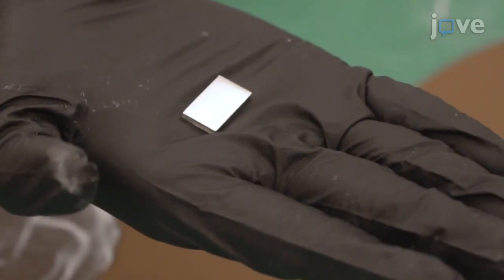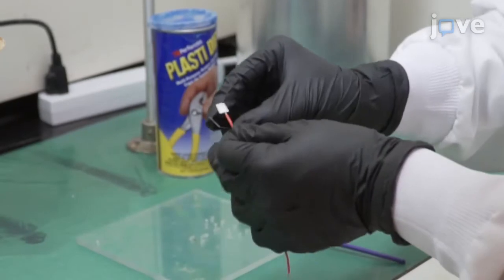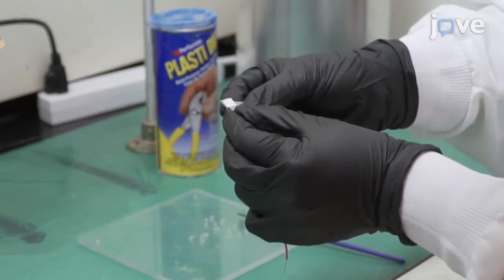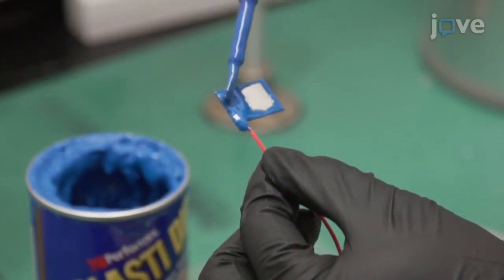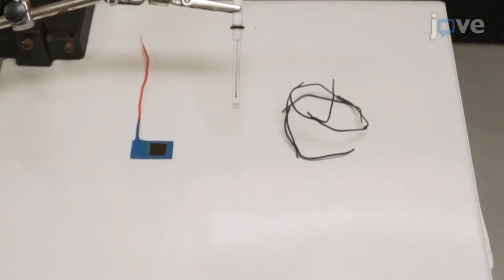While attempting this procedure, it's important to remember to achieve a mirror finish of the sample before the test and to ensure good electrical connection between the sample and the connecting wire.